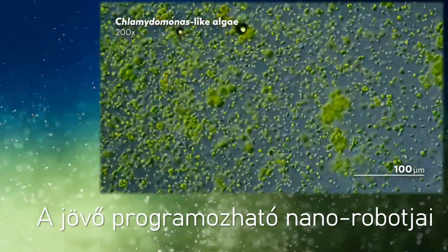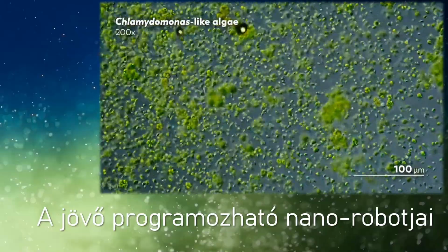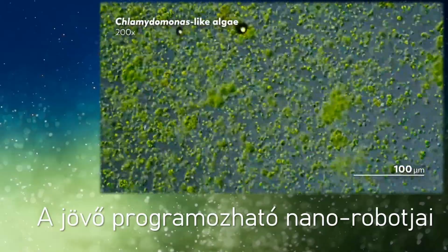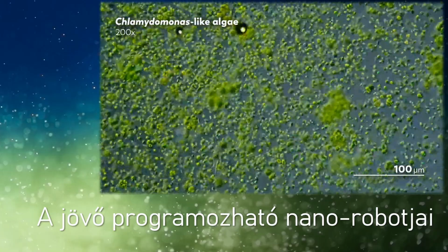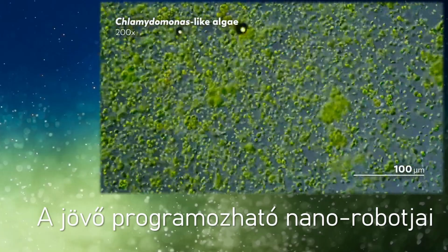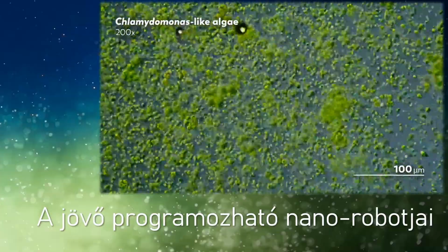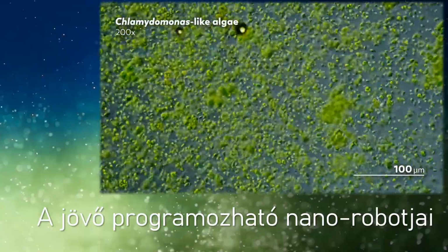Your screen is currently filling up with clouds of an algae that resembles a unicellular flagellate known as Chlamydomonas. Though we're not quite sure that that's definitely what it is, the algae are swimming towards the lit part of the stage, and as they amass, they form a blanket over the slide that looks like a kind of very festive green television static.